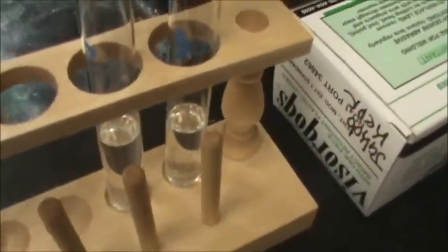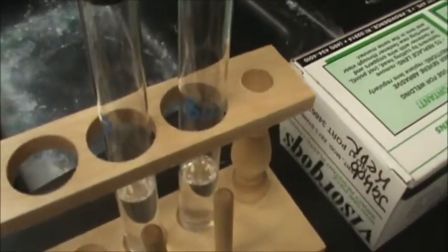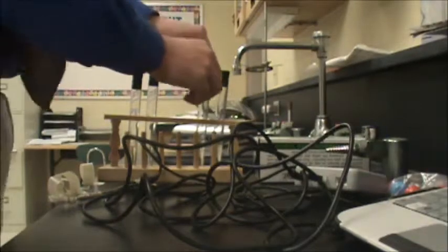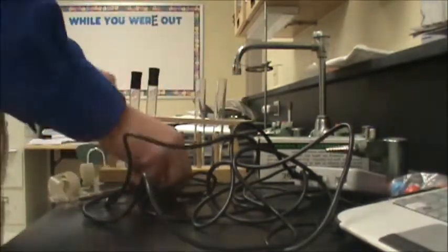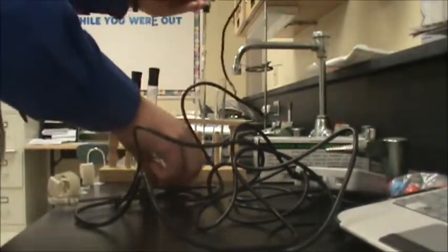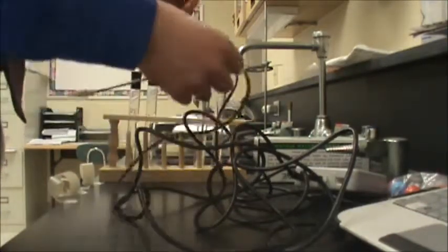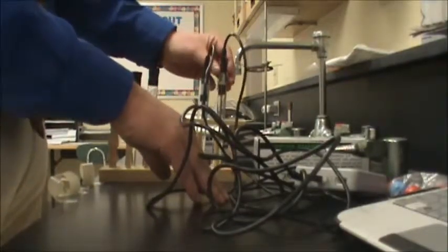So we're going to start off with our alcohols. The first test tube is propanol. The one over here is butanol. And we are going to put our temperature probes right in there just like so. Here it comes. I'm going to set you aside here so you can see what I'm doing. Take the stoppers, pop them off, just like so. I'm going to put temperature probe 1, slippery darn things, into propanol right in my test tube. Let it sit in the liquid to kind of soak. I'm going to put temperature probe number 2 into my butanol, just like so.